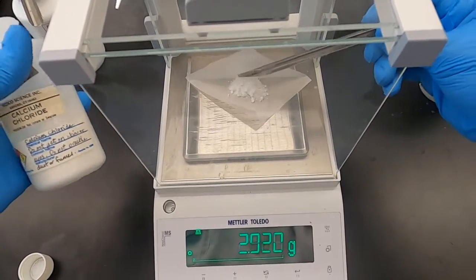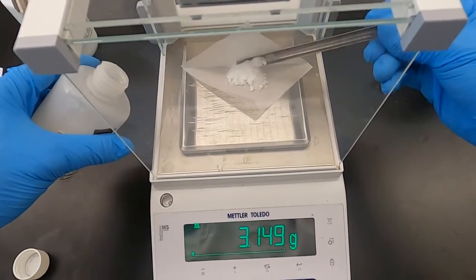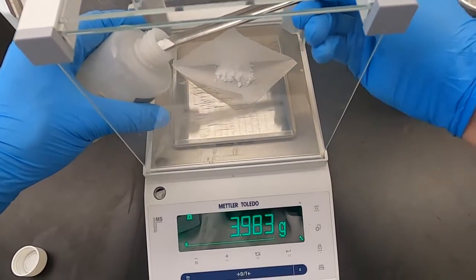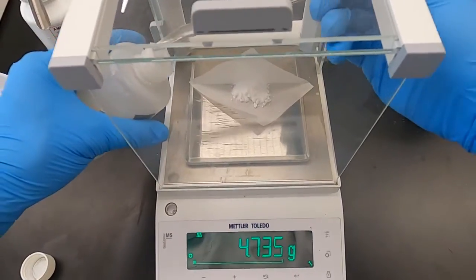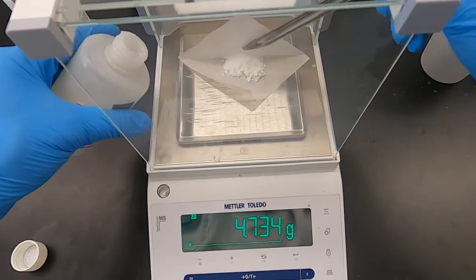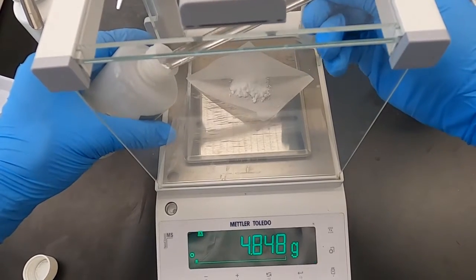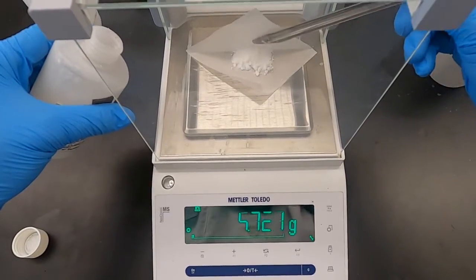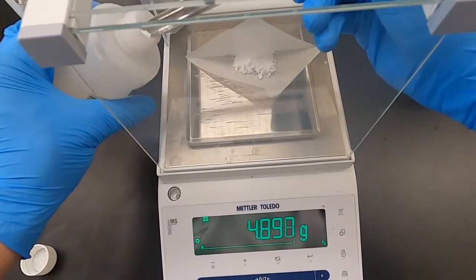So again, this is calcium chloride now. The previous reaction, the temperature decreased. Think about whether that was exothermic or endothermic. As we get closer to 5 grams here, 4.7, we slow down these scoops. Take it slow, nice small ones. If we did go over, all I would do is scoop a little bit off the paper and throw that away. Or if it was more dangerous, I would throw it into a waste bottle where it would go and be treated.